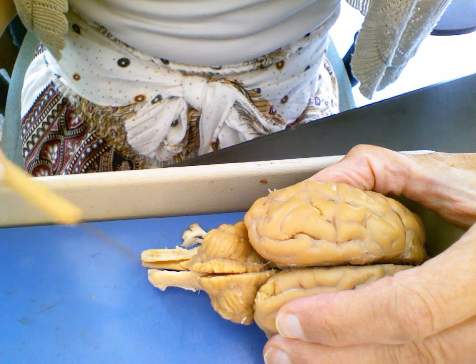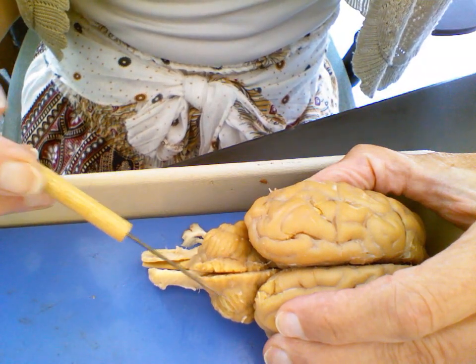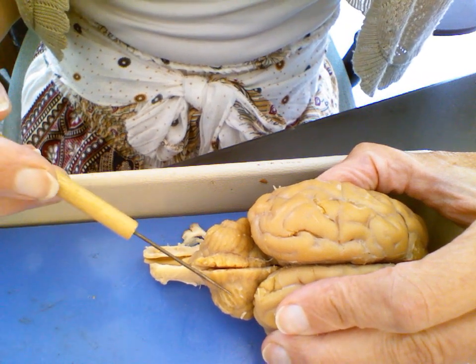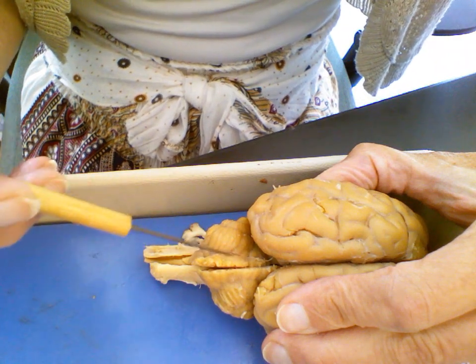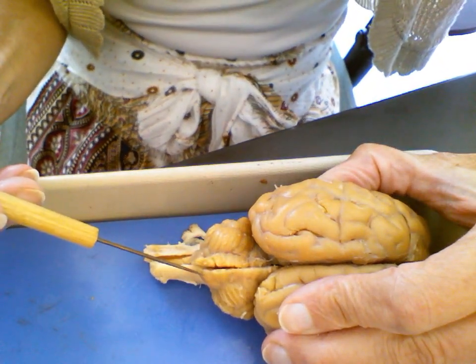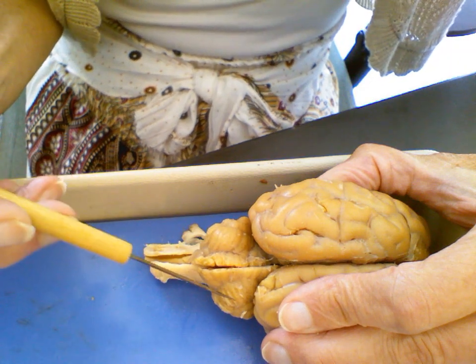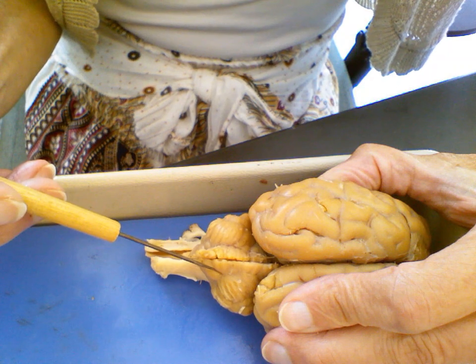There we go. And so this right here is the part of the brain which is known as the cerebellum, involved with balance, coordination, and memory. This mid part, this part that's sticking up, this wormy-like structure coming right down the center, is called the vermis. So we have the cerebellum with this midline area called the vermis.